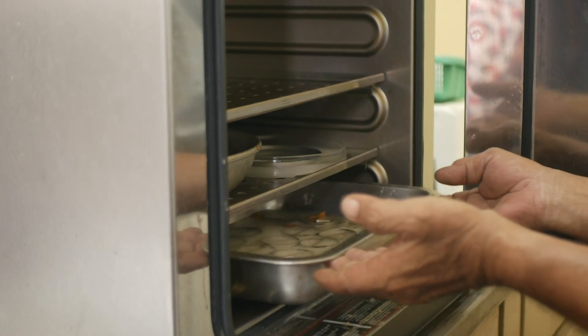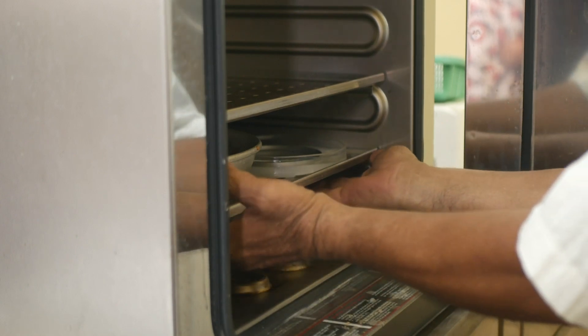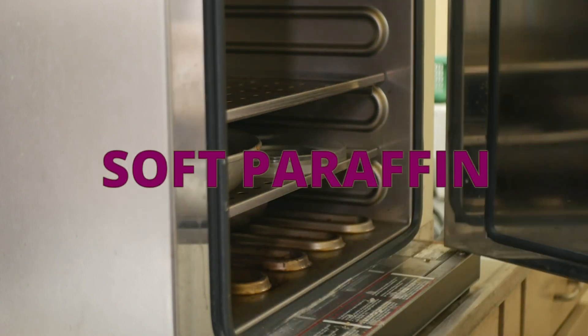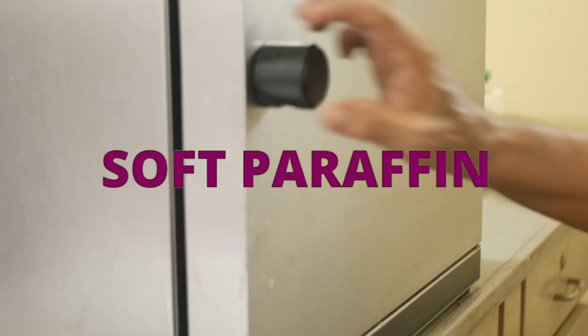As you can see, tissues are first impregnated in soft paraffin, which will completely remove the clearing agent and fill all the tissue cavities.